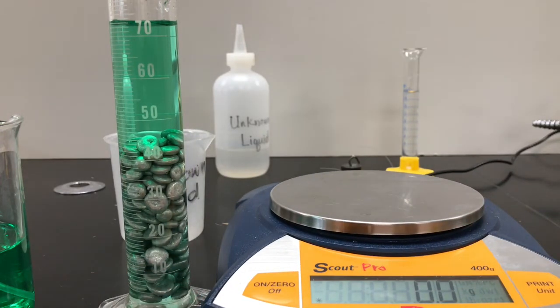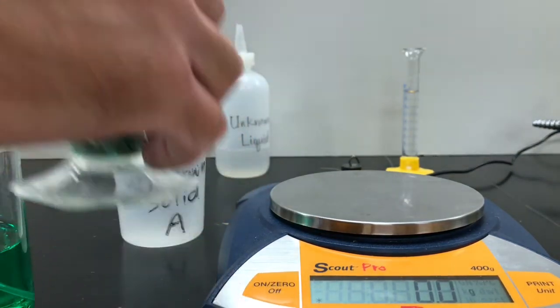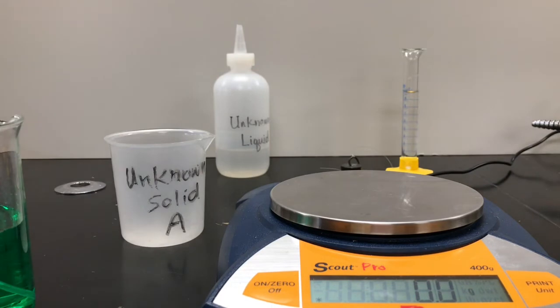Okay. Now, what I need to do is do our last sample. I have to pour all this water out. I might have to refill the water because it's between all the pellets. And that's okay, we can do this. So off the side here, I'm going to get rid of the water, free up our pellets, get them out of the cylinder.